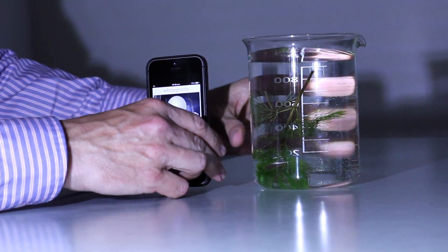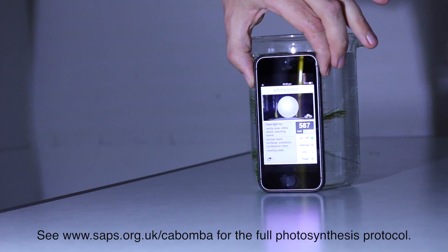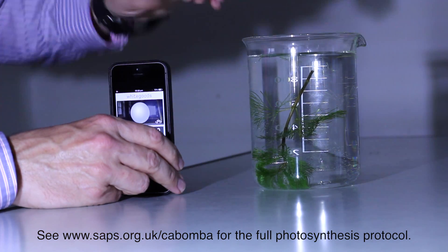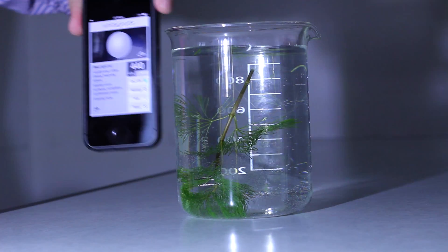I gradually move this closer and at each stage take a new light reading, and of course record the number of bubbles being given off over the course of maybe one or two minutes.